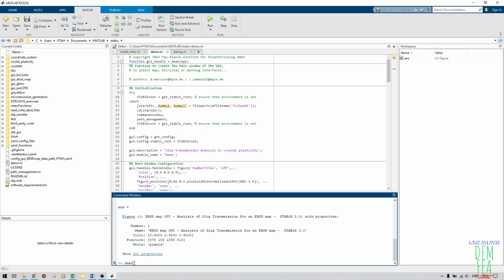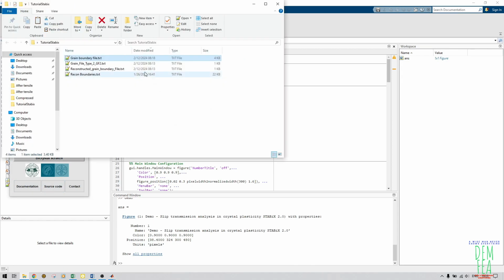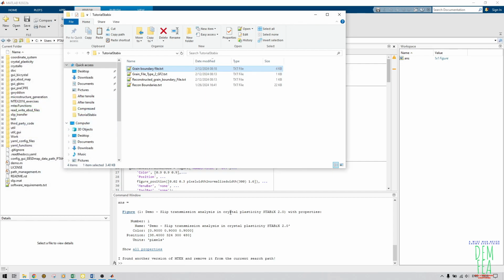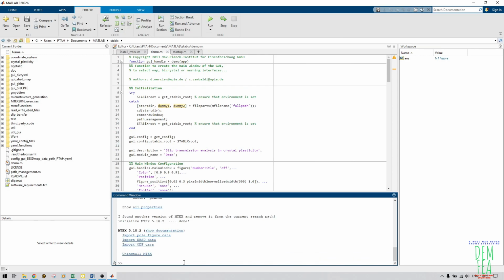What I do is write demo here, and once I write demo, this GUI, graphical user interface, will appear, and in my case I already have my files here. I have my grain boundary file and I also have my reconstructed boundary file, the raw files, just as I exported. But there are some errors that we'll encounter while trying to import these files. So let us try and import these files. As you can see, I've clicked analyze EBSD data, so we are waiting.